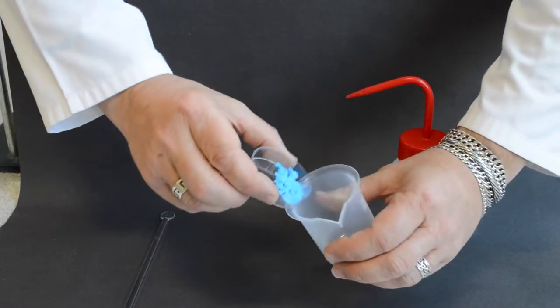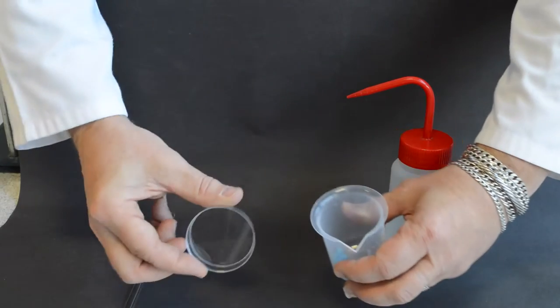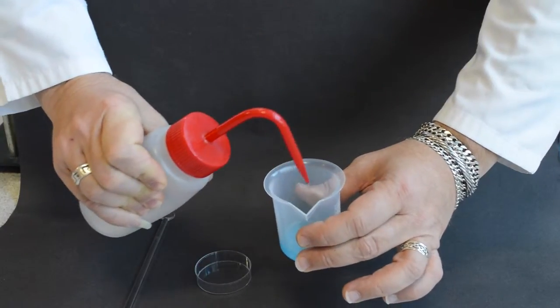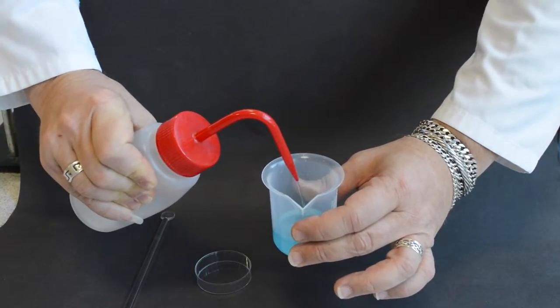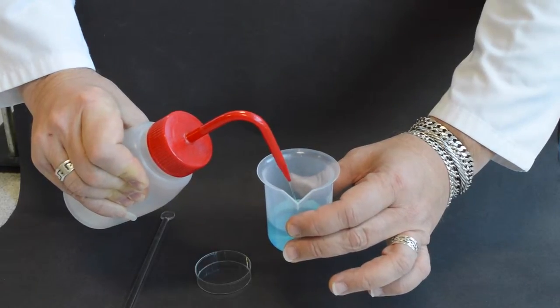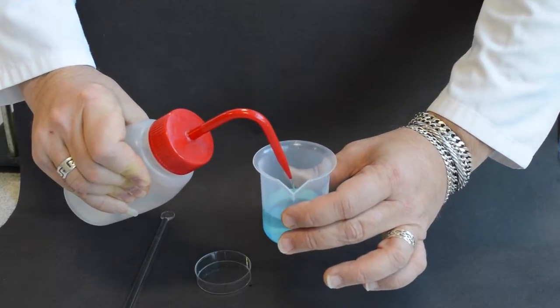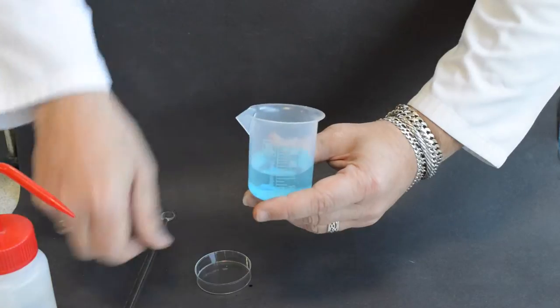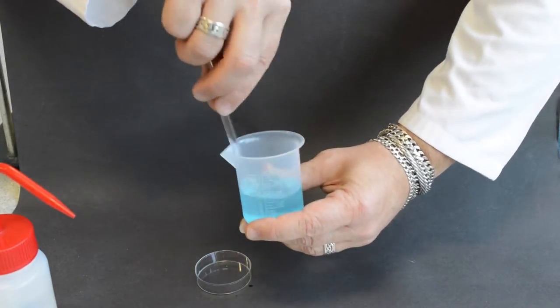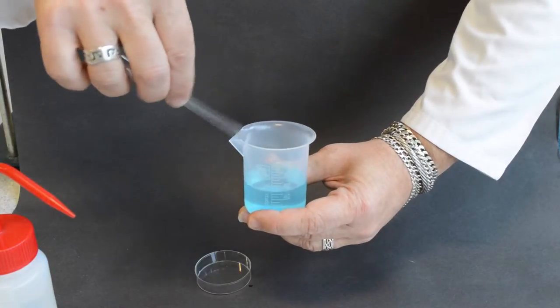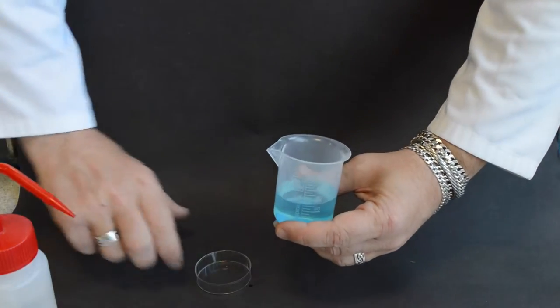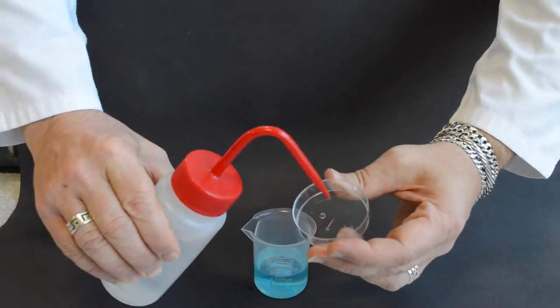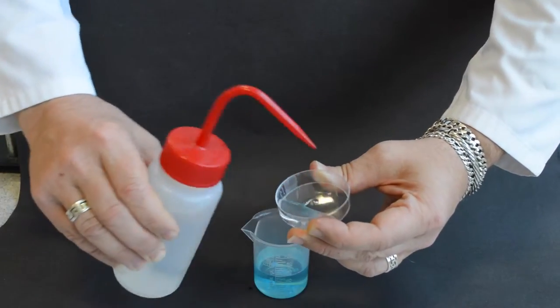Take the accurately weighed two grams of copper sulfate, place into a beaker, then add distilled water. Stir the solution with a stirring rod to make sure that all the solid has dissolved. Wash out the weighing vessel with distilled water to ensure that no trace of the sample is left in the weighing vessel.